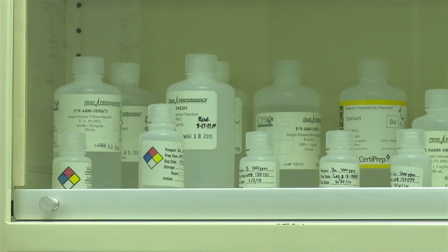Mostly we use this to monitor scale inhibitor treatments. An ICP analysis can be used as a sort of fingerprint. For instance, we can tell the difference between a Cretaceous seawater and the modern epoch seawater. OES is capable of analyzing for about 70 atoms. However, we have a list of the 13 pertinent atoms here.